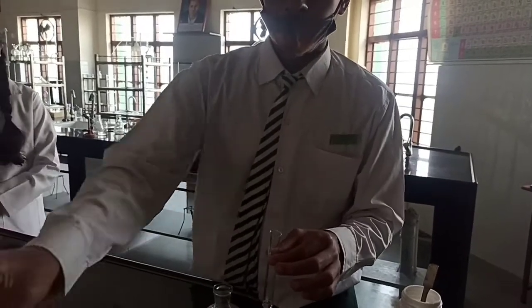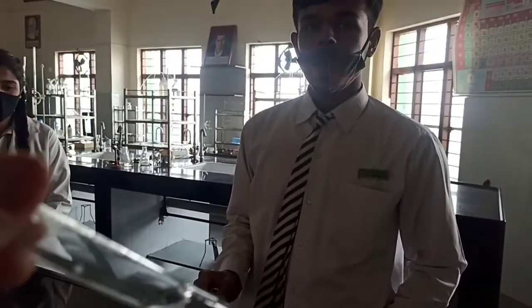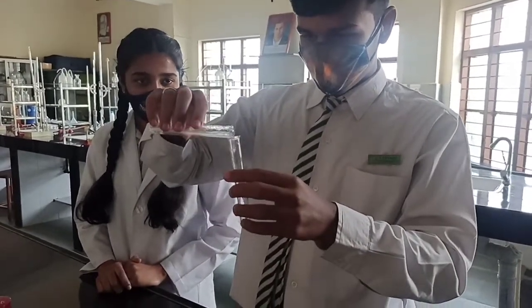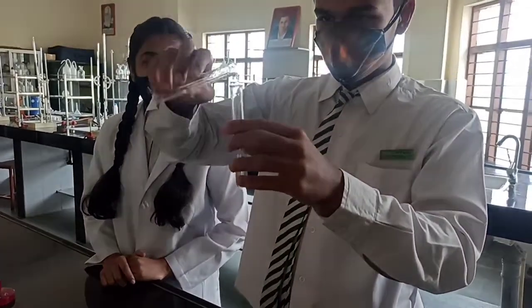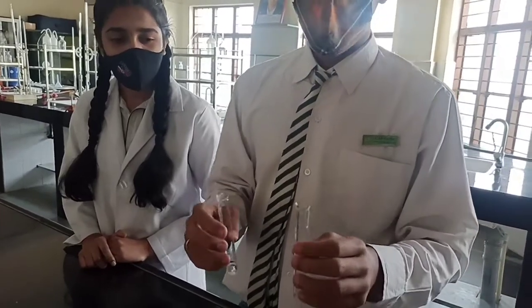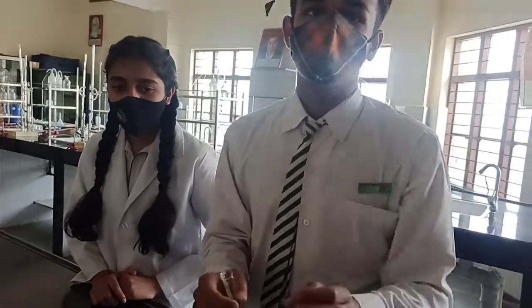So now we will perform the confirmatory test with the salt solution or the original solution which we have already prepared. Now what we are going to do with this salt solution? We will divide it into two test tubes, or you can say you will make two parts of it. So make it. Now divide it into two equal parts. And now your solution is equally divided into two parts. In one you will do the first confirmatory test which is the dilute HCl test. And in the second we will do the magnesium sulfate test.